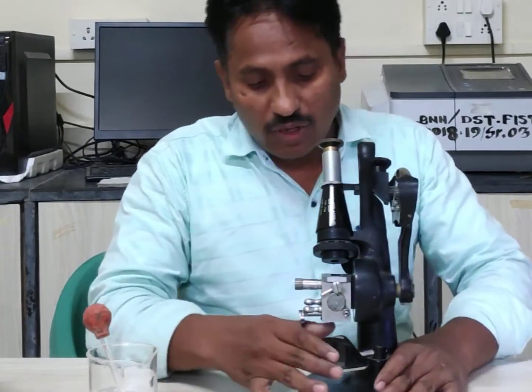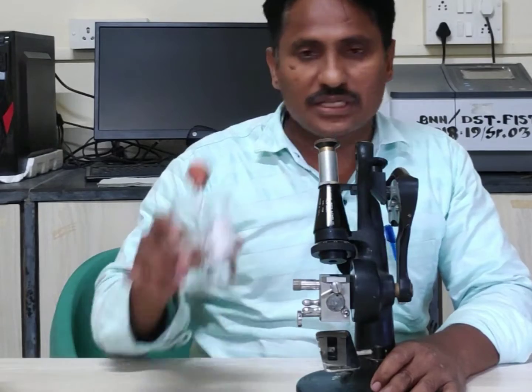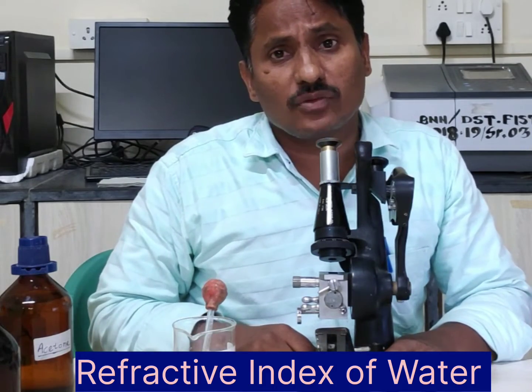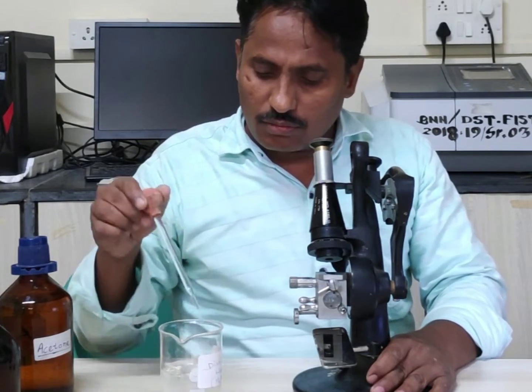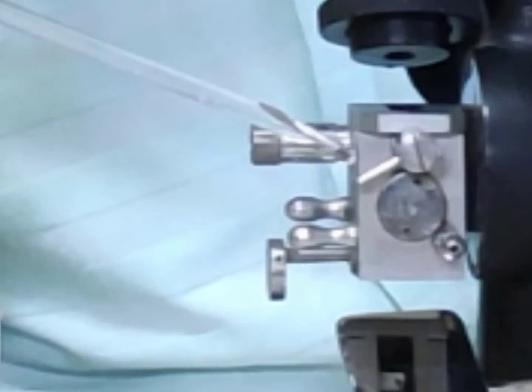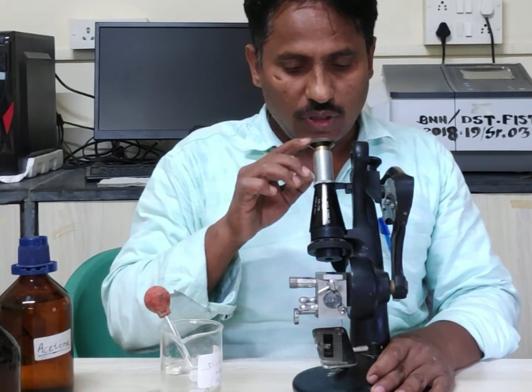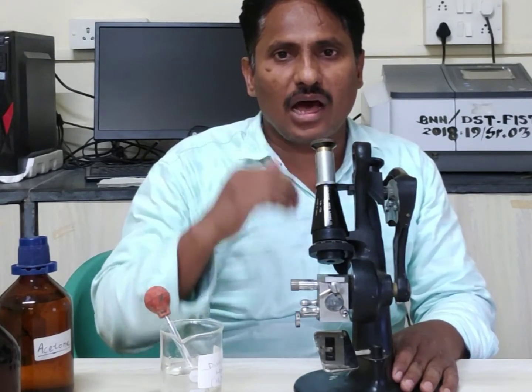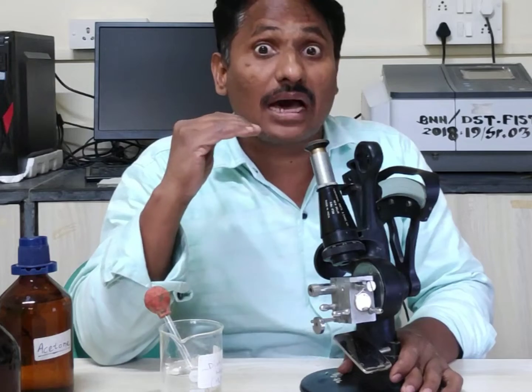Now we are going to measure the refractive index of different liquids. Today we have three different liquids. We will start with water. You insert the sample through the hole, then observe through the telescope. The image in the telescope should be half bright and half dark, and we have to adjust that with the help of the main knob.